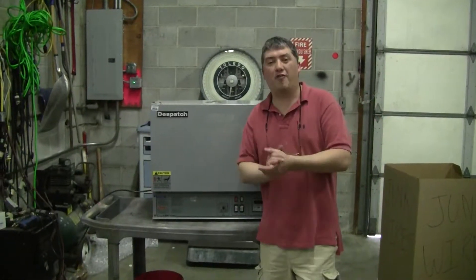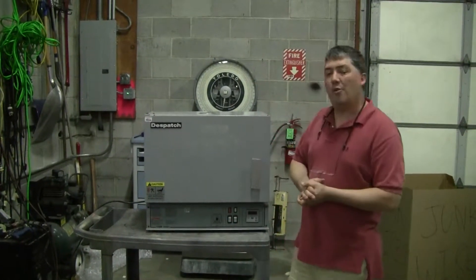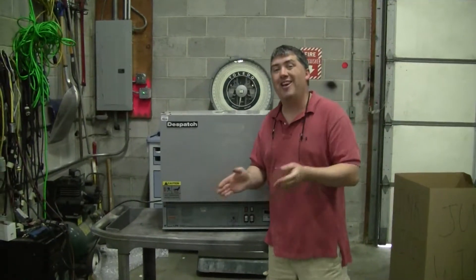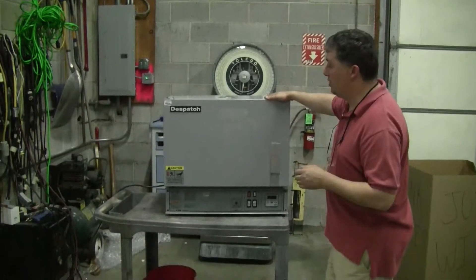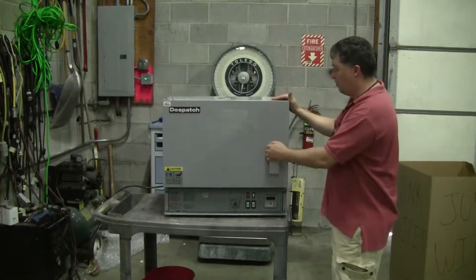Hi, this is Michael Natale from HiTechTrader.com. Today I want to talk to you a little bit about mechanical convection ovens and gravity ovens. These are ovens that are used in the laboratory and the science group.